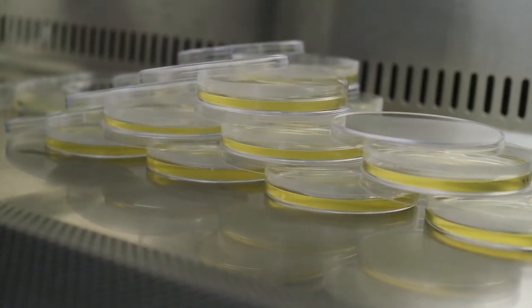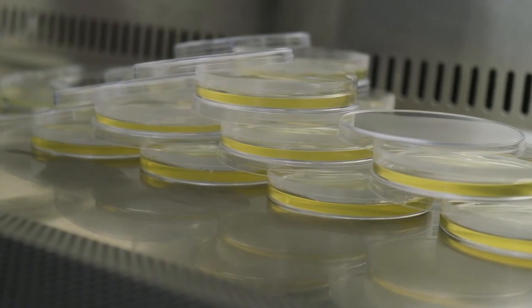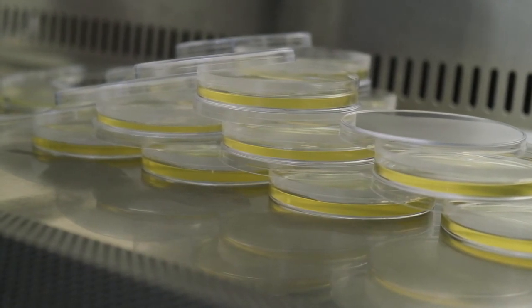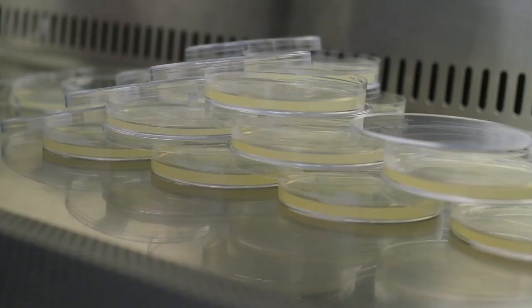As the agar solidifies, it goes from clear to cloudy. After about 20 minutes, the agar is now solid.